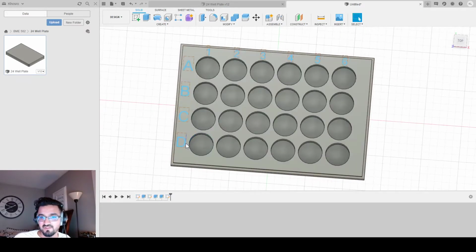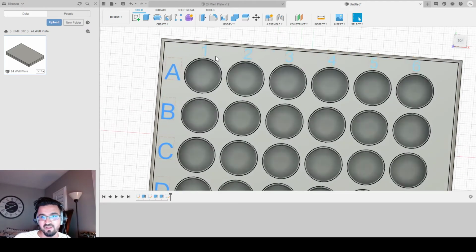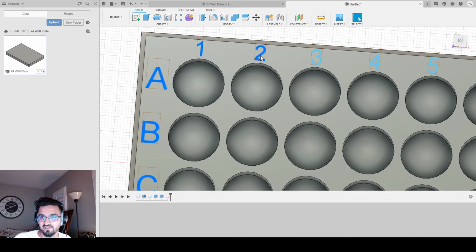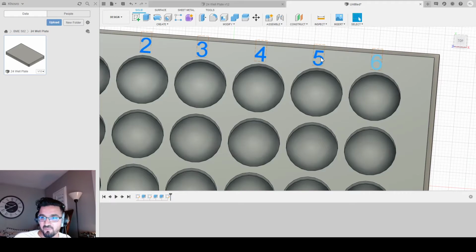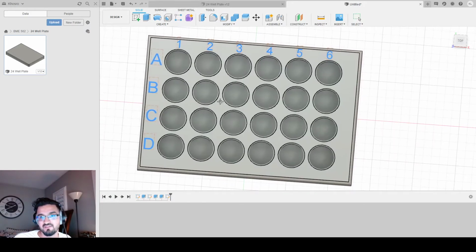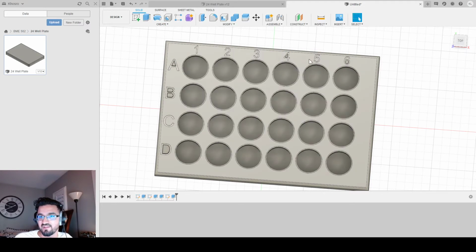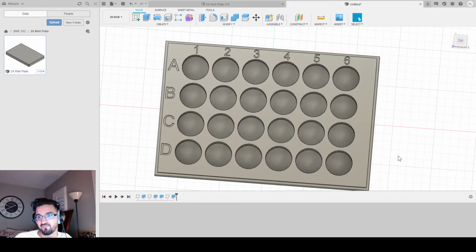Now what you're going to do is select every letter, right? And that's kind of easy. The mouse kind of helps. If you see that it's not selecting, like this one is hard, just zoom in. It'll make your life easier. You could always zoom in and drag. And I'm selecting multiple things at once by holding down Control and clicking. So now that I've selected everything, all I got to do is extrude this by -1 and click OK. And now I have engraved letters on my 24 well plate.